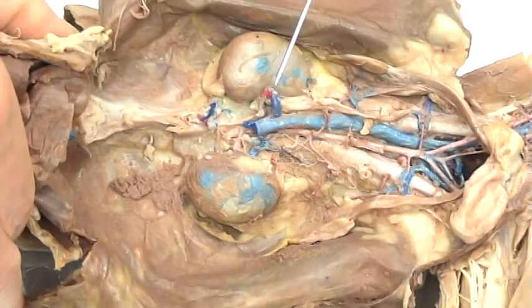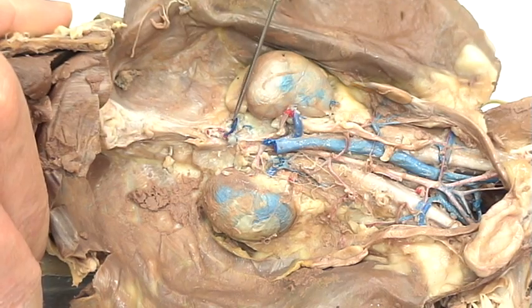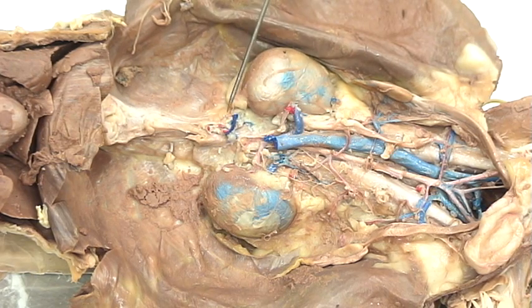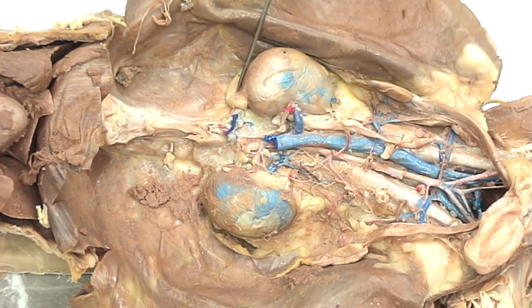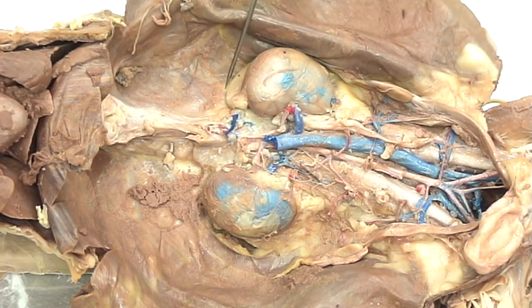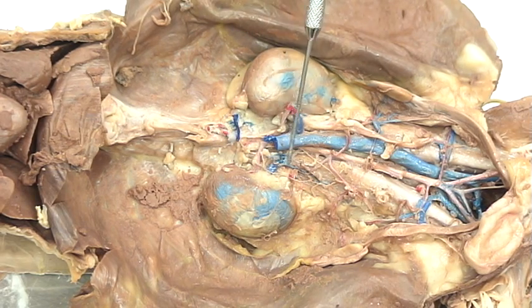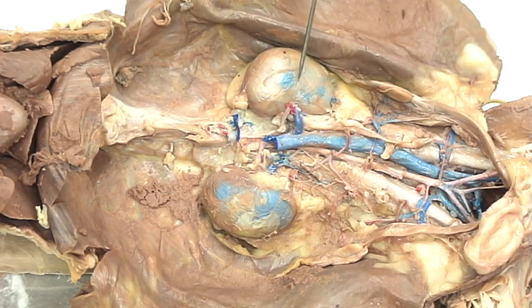So we can go right into what we can see. We see a little remnant up here of what leads into the adrenal gland, or the suprarenal gland. This is the adrenal lumbar vein — adrenal because it's the adrenal gland right here, and it also feeds the lumbar region of the body. Now, these veins right here will lead into both of the kidneys, so we'll call those the renal veins.